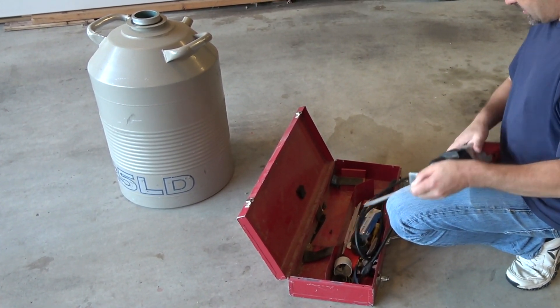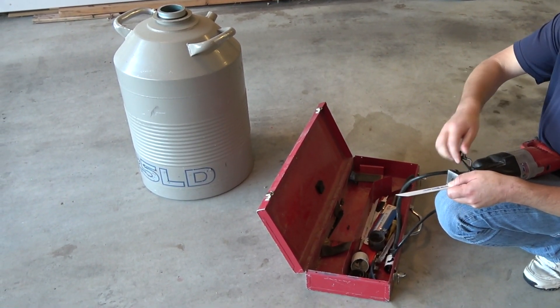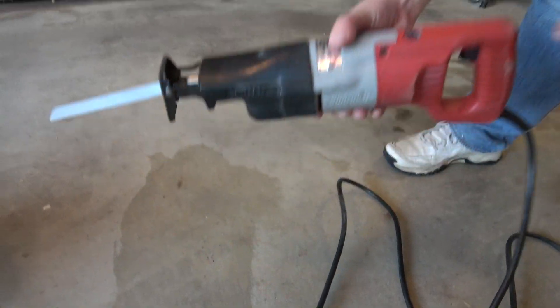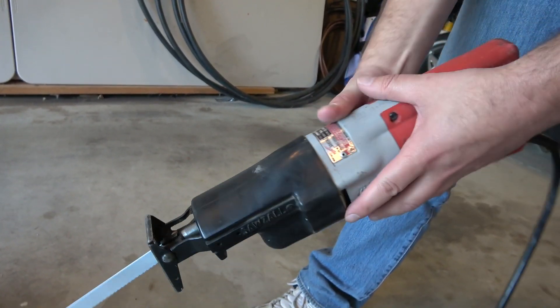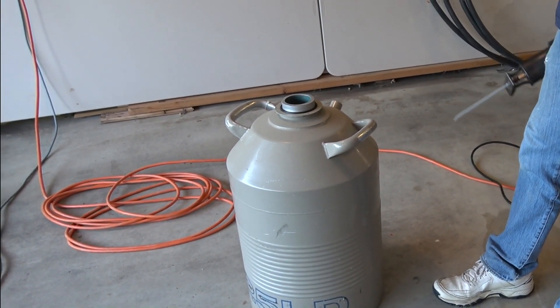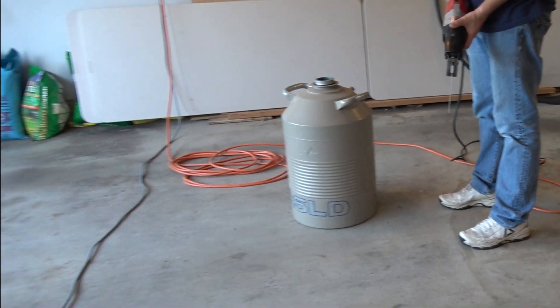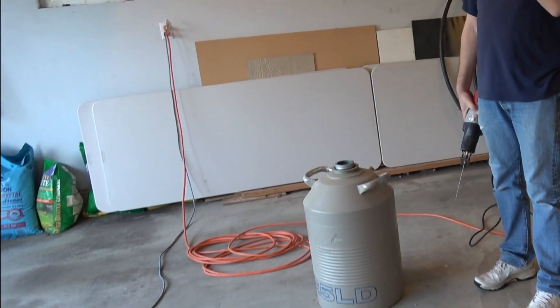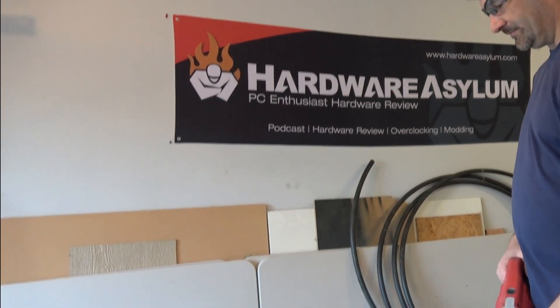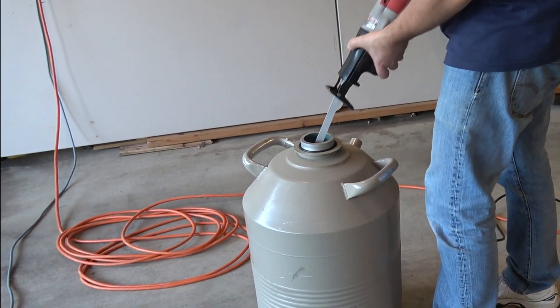You're going to put this in here, and there's a key at your end. Kids, at some point we should say don't try this at home — but you probably don't have a dewar and a Sawzall at home. Oh, the Sawzall — you've seen these before. You are going to hurt yourself. No, no, it'll be fine. Almost ready. Come on, it's not going to be that bad. I've seen those videos. I have my safety glasses on and everything. Alright guys, here we go — don't try this at home.